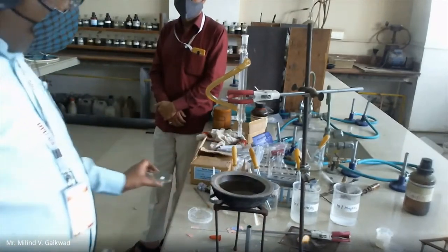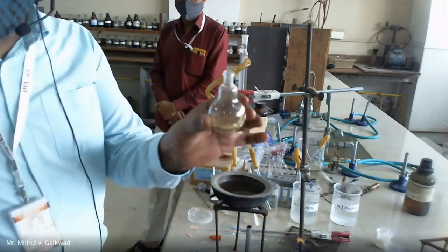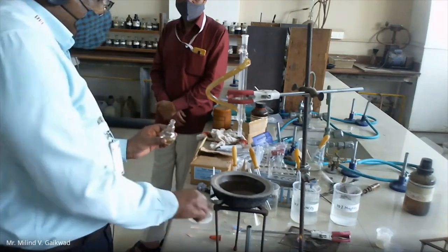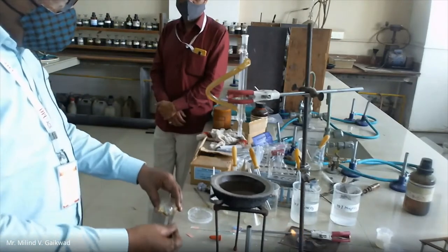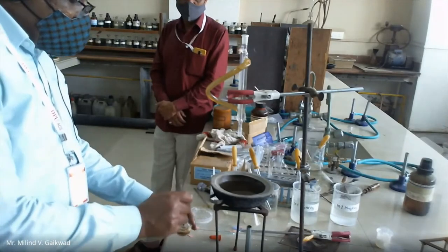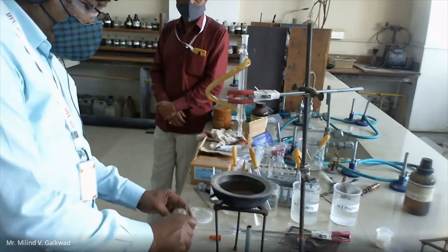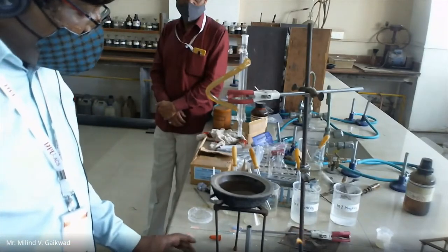Now, if the given compound is liquid plus liquid, then what happens? Here what I will do — I will take some droplets of this compound on the glass plate and you have to check whether you are having a solid particle or not. If you are having solid particles, then you can say that it is solid-liquid; otherwise it is liquid-liquid.